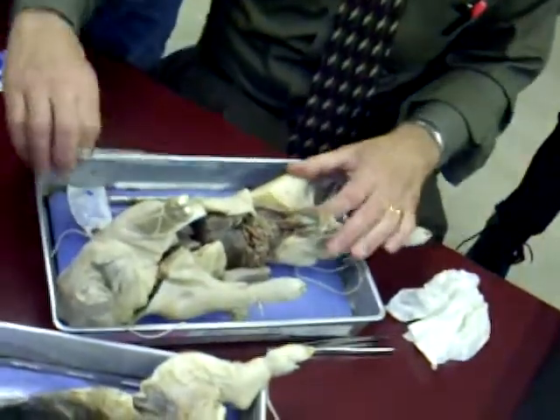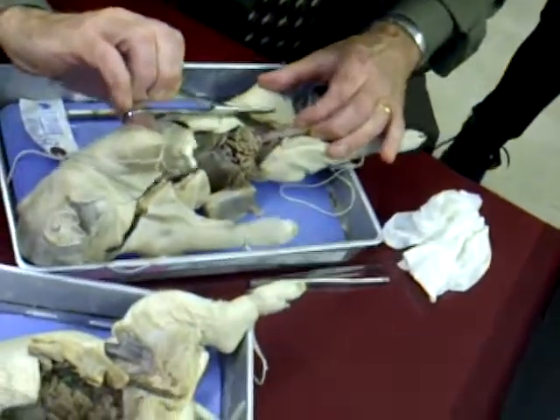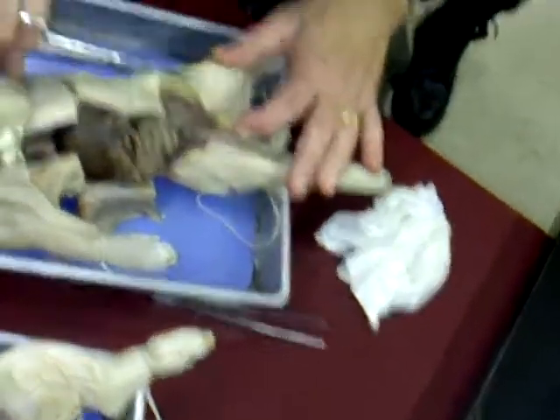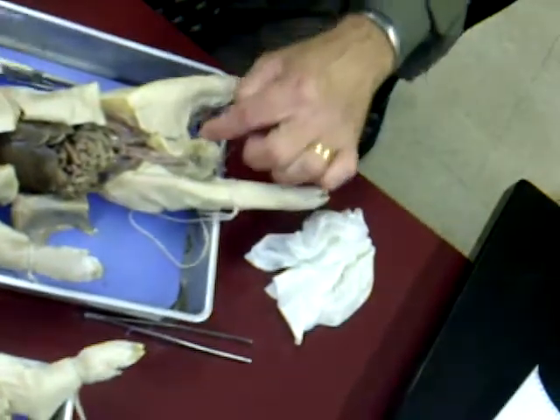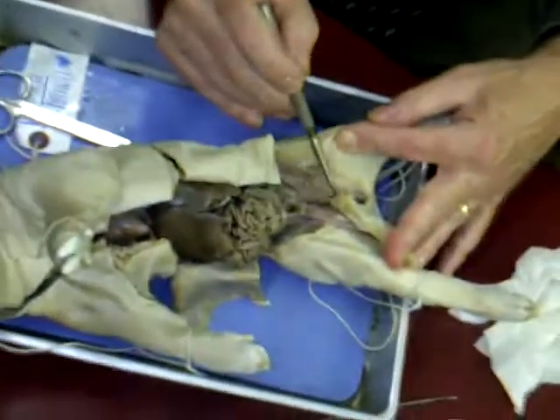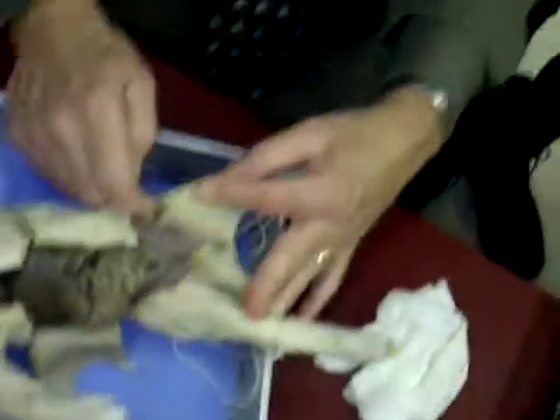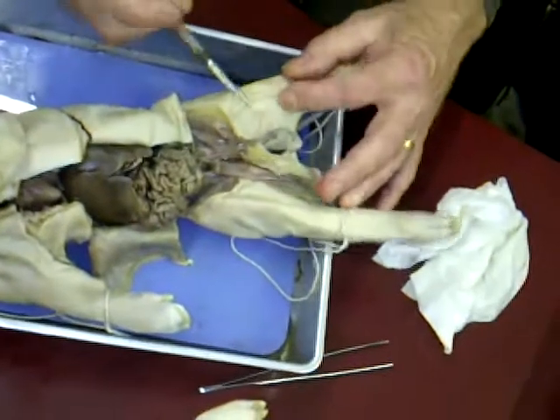Anyway, we're going to pop them open by cutting the abdominal cavity through the pubic bone like we did in the female. We'll stay on one side so we can actually expose the route of descent of the testis and the epididymis that surrounds it through the inguinal canal right into the scrotal sac. So we cut that open, and now we can see right here, here's the vas deferens, which comes from the epididymis, which collects the sperm that's made in the testes and the seminiferous tubules of the testes. And here we can fish it right out of the scrotal sac, and there it is.